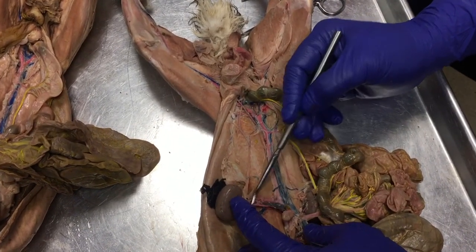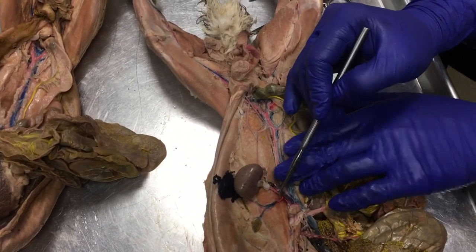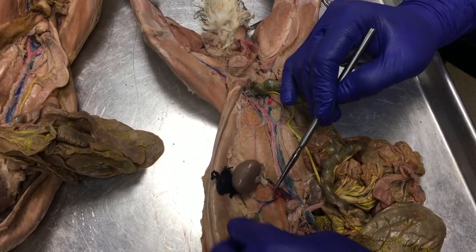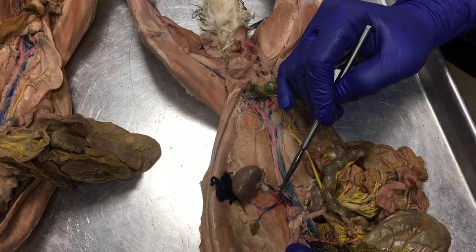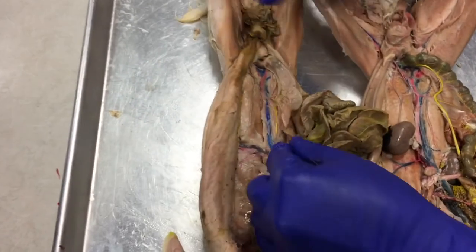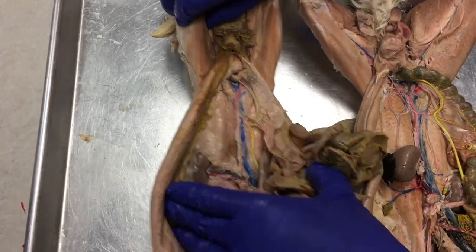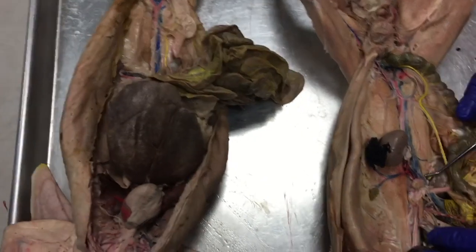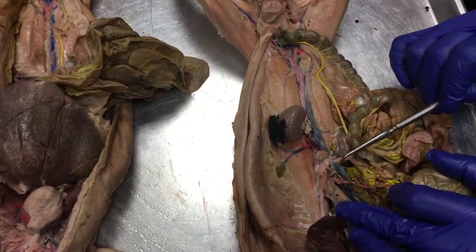Look at that big blue renal vein. It's also joined by, just pretend it goes there, the adrenolumbar vein. This one's not injected. Look at renal, and you can see a little bit of the adrenolumbar. All of those join into this blue post cava.